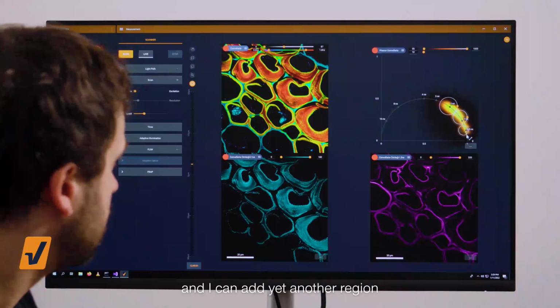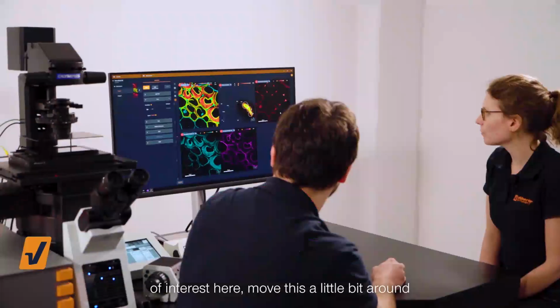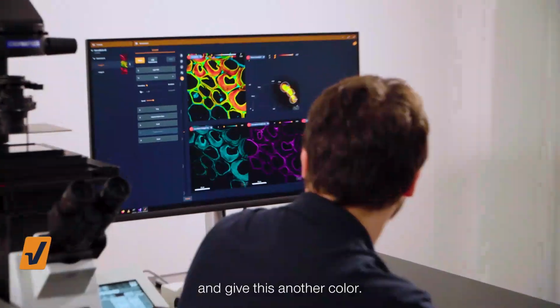And I can add yet another region of interest, say up here. Move this a little bit around. And give this another color.